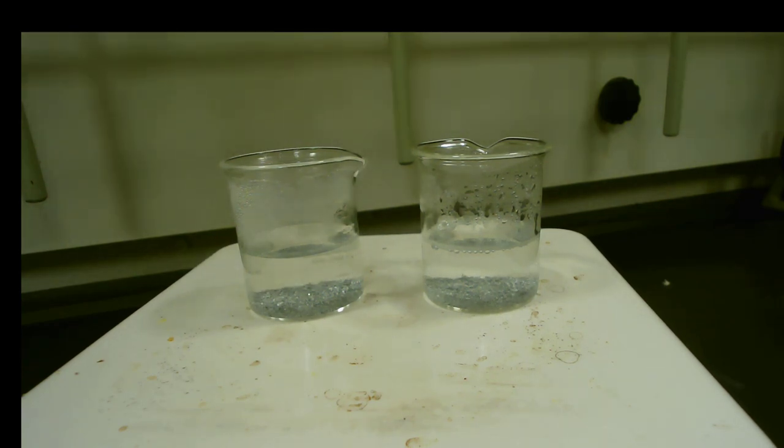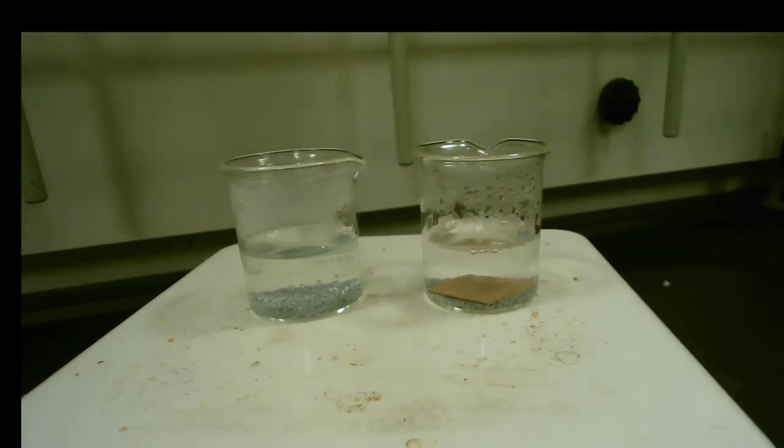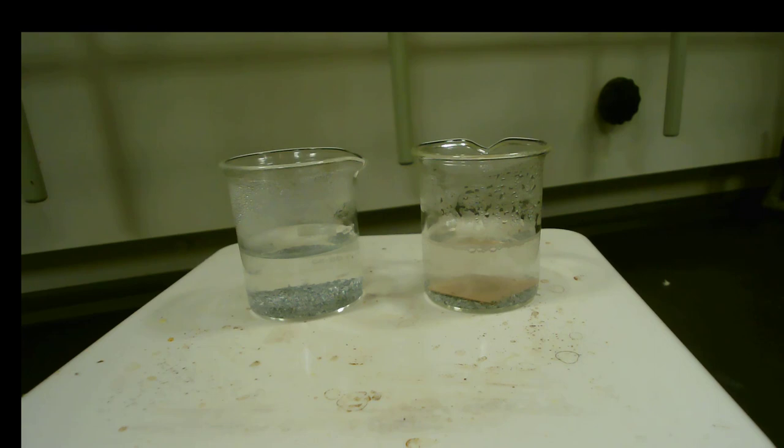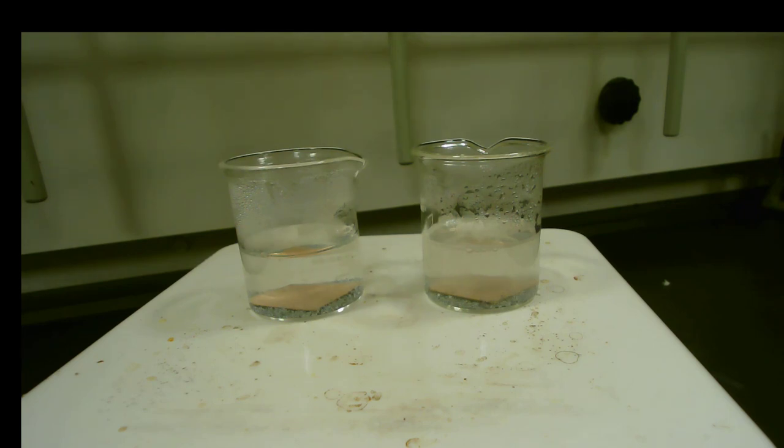Now it's time to add our copper sample flat in the bottom. Now we watch the magic happen.